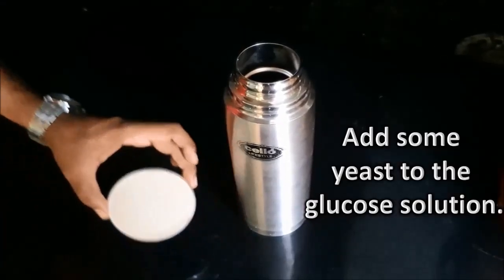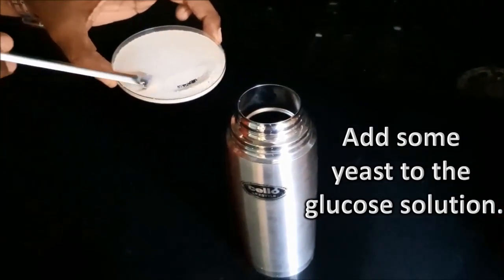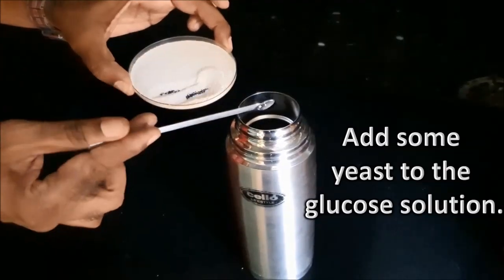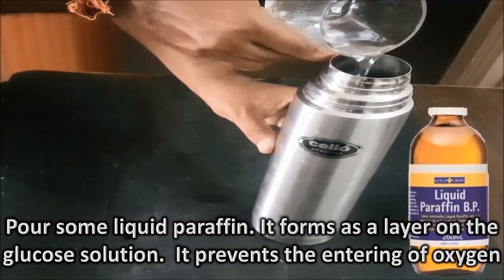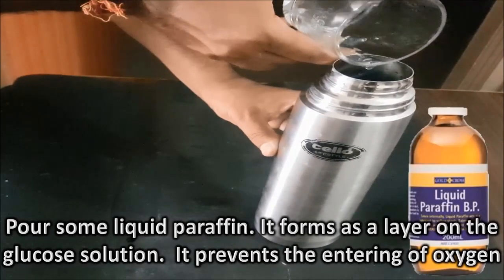And add some yeast powder to the glucose solution. Pour some liquid paraffin. It forms a layer on the glucose solution and prevents the entry of oxygen.